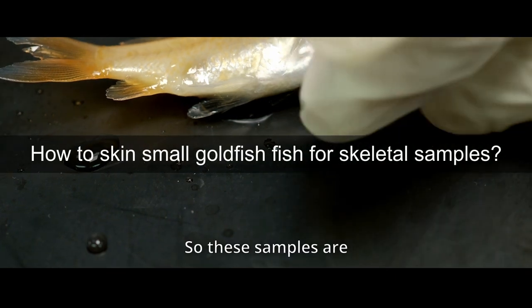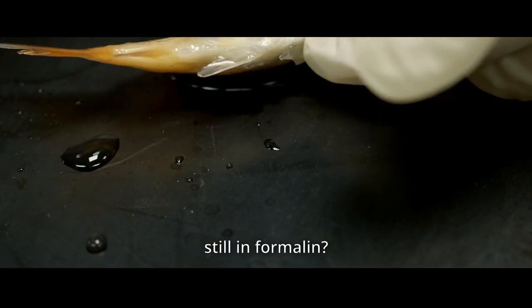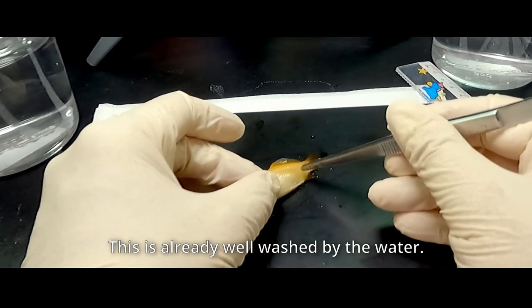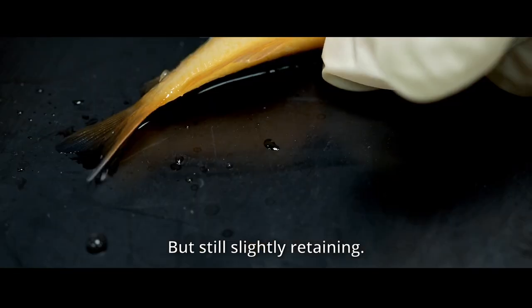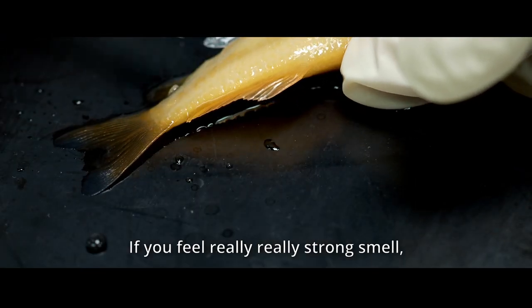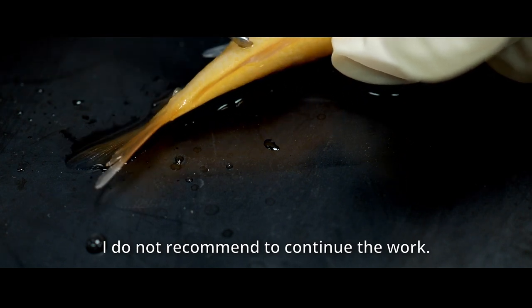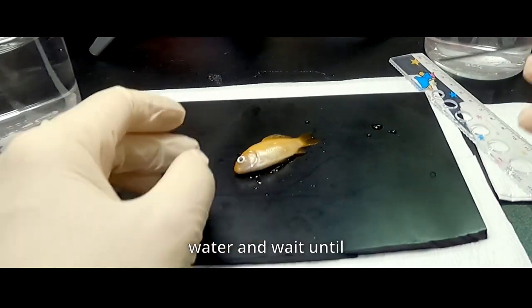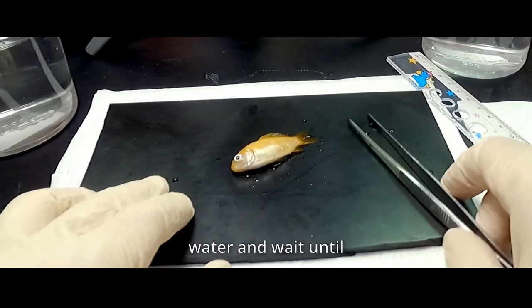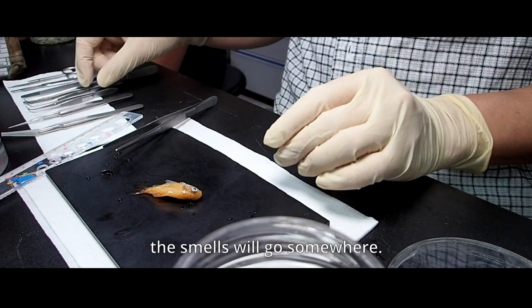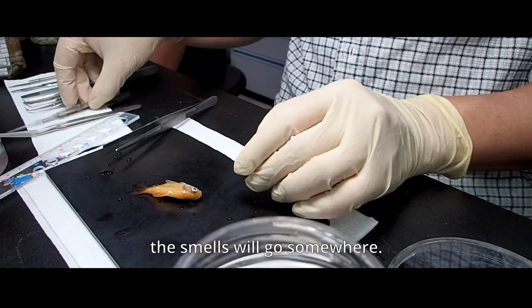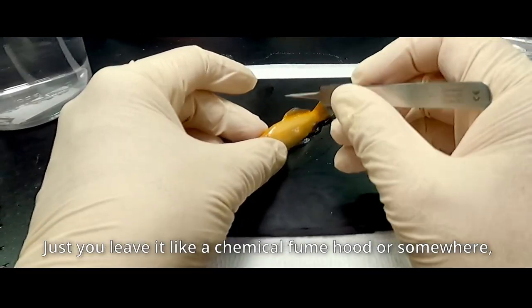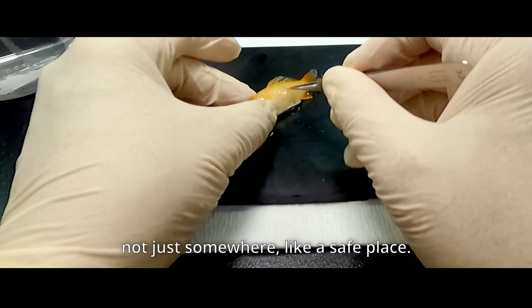So these samples are still in formalin. This is already well washed by the water, but still slightly retaining. If you feel a really strong smell, I do not recommend to continue the work. Just keep it inside the water or running water and wait until the smell goes somewhere. We don't just leave it in the hood or somewhere, not somewhere like a safe place.